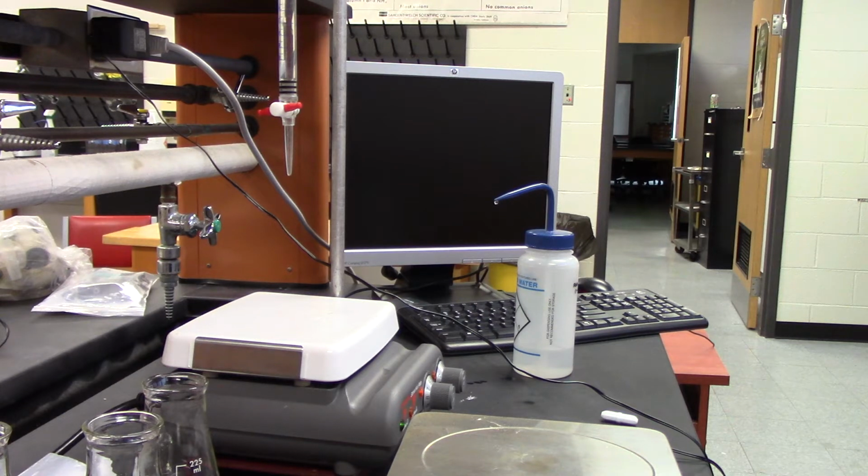For every mole of base that you use, you titrated a mole of acid. We'll be using phenolphthalein to determine when the amount of acid is equal to the amount of base, when it turns pink. So if I know how much base, I know how much acid I have. Molar mass is grams per mole. I know how many grams I have because I weighed it out, and I divide that by the moles I find doing this experiment, and I get its molar mass. We're going to be doing three samples and getting the average.